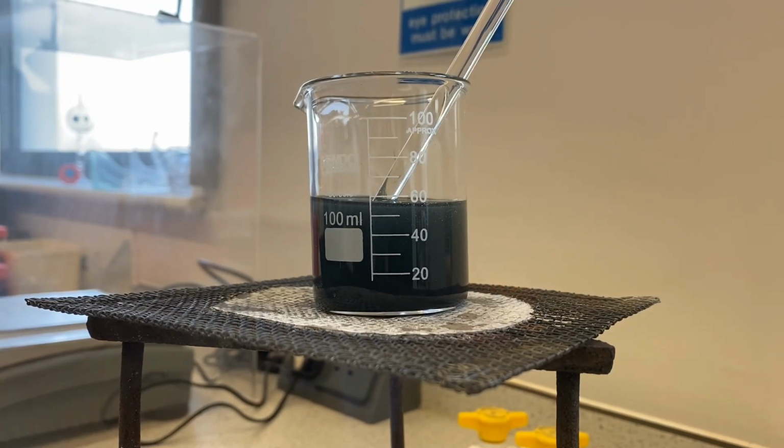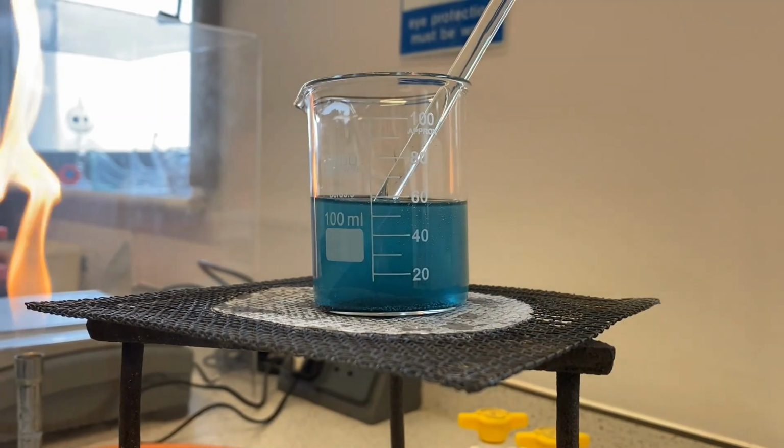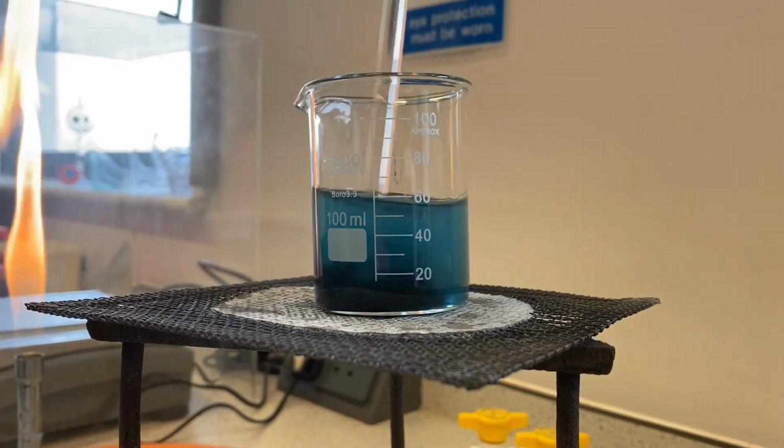And as the reaction takes place, you might notice a colour change. For those of you who are very observant, you will notice that at the top, it's starting to change colour. We're looking for a beautiful blue solution, which hopefully you can just about see starting to happen now. Just going to move the Bunsen away and pop it onto the safety flame. You can see already we've got that nice blue colour appearing. Let's give it a bit of a stir.